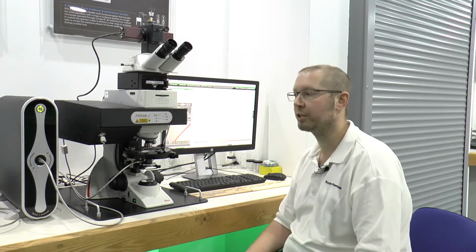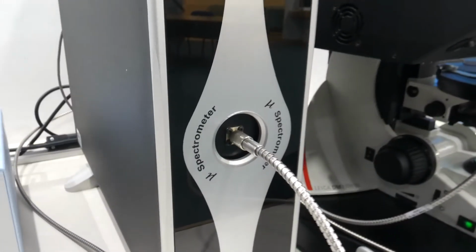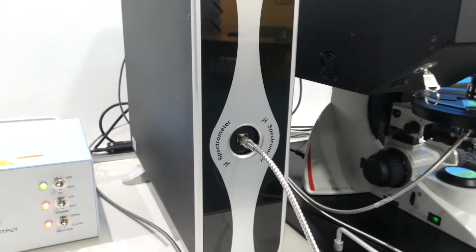Here we have the Foster and Freeman FFTA, the Trace Evidence Analysis System, and we're going to be using the UV-Vis NIR microspectrometer module to examine the textile fibres, and we're going to use the VSC style imaging suite to examine the suspected hairs, where we can do some annotated measurements and overlays to help us with our comparison.